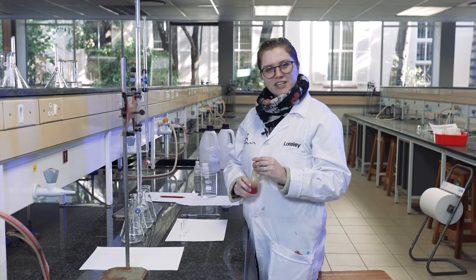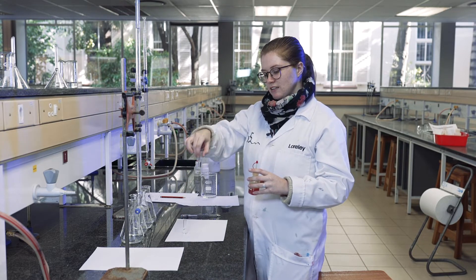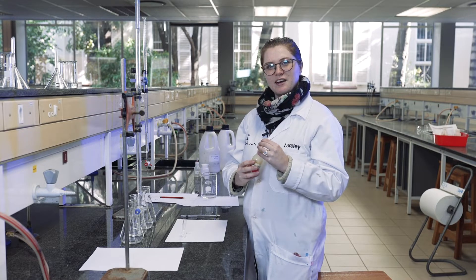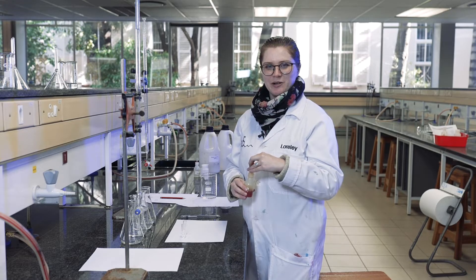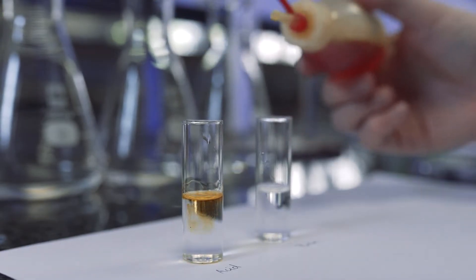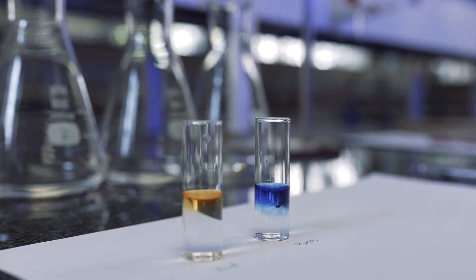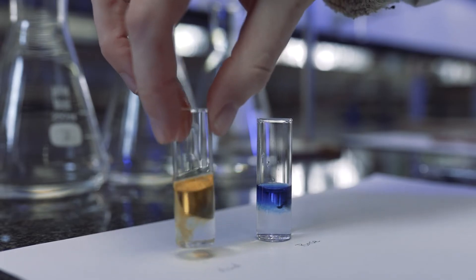Before we start with our titration we need to make color standards. We're going to do this by adding a small amount of our acid into a vial and adding a drop of indicator into it. This will tell us what color our indicator is in an acid and in a base. The combination of the two colors will be the color we're looking for at our endpoint. We can see we've got a yellow and a blue color, so mixing the two together gives us green — green is going to be our endpoint color.